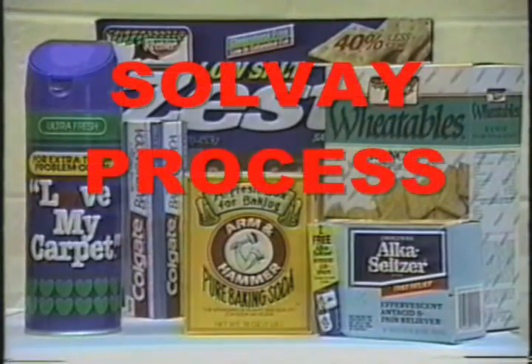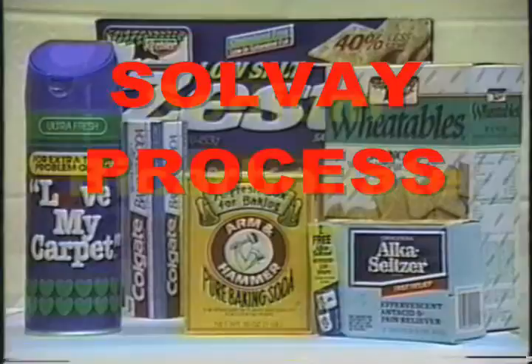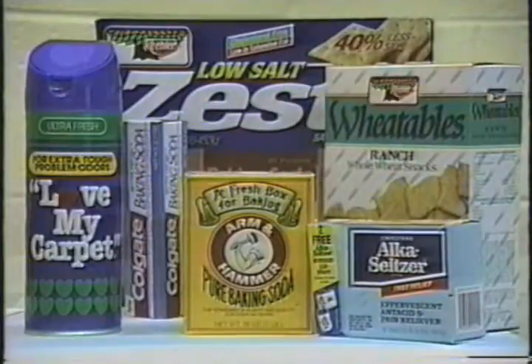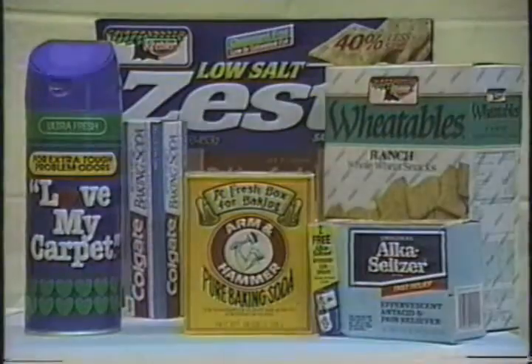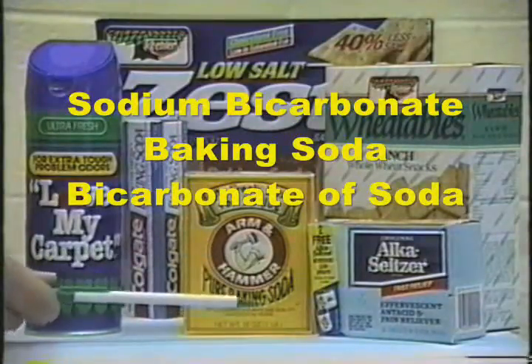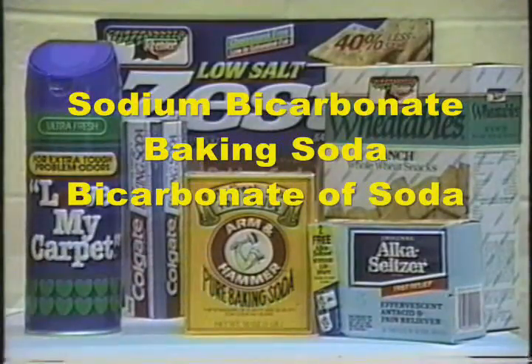In today's experiment, you'll synthesize sodium bicarbonate. This is a very common chemical with which you should already be familiar. Go to any grocery store and you'll find pure sodium bicarbonate. You'll find it under its common name of baking soda.